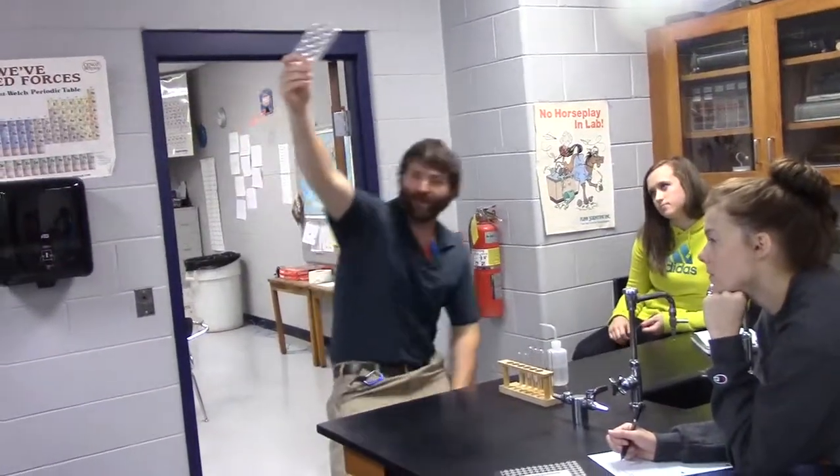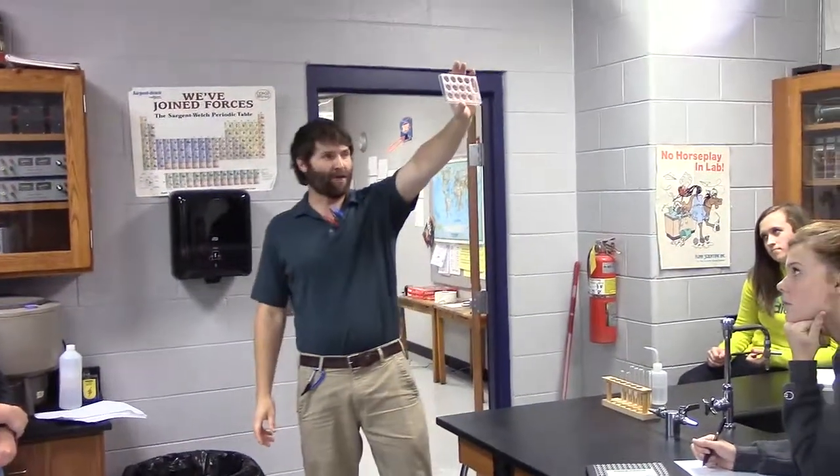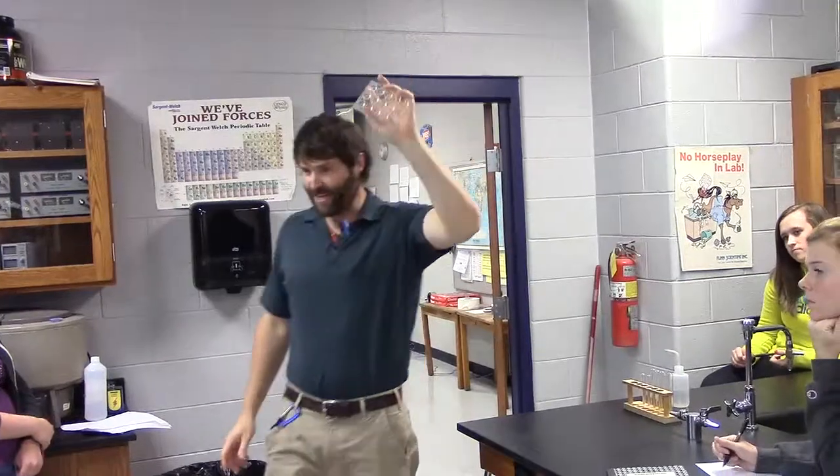Today, we're going to be learning how to do what's known as a flame test lab. Alright, I'm going to go ahead and get one thing out of my drawer. This is what's called a 12-well spot plate. So I'm going to go ahead and get this out of my drawer.